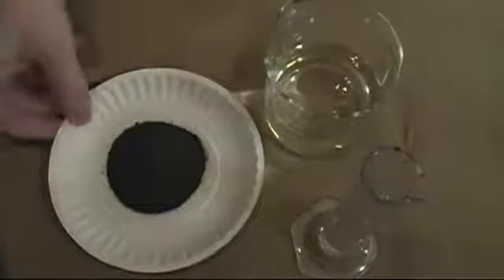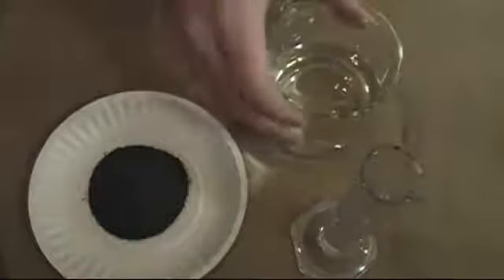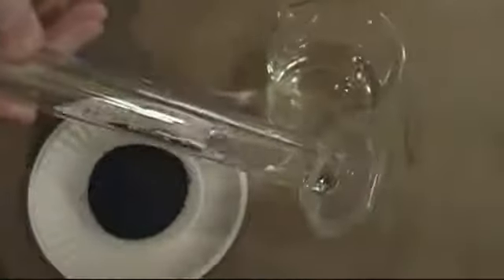Start by weighing out 120 grams of iron powder. I may do another video later using tin, but iron powder just happened to be what I had in the lab right now. Followed by 140 milliliters of distilled water, and then 15 milliliters of 31% hydrochloric acid. I'm just using pooled muriatic acid.